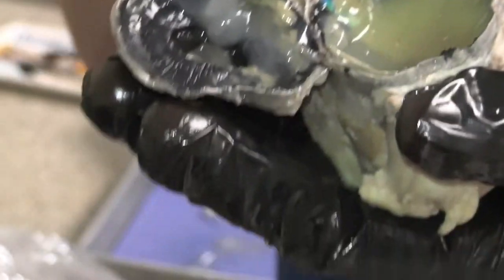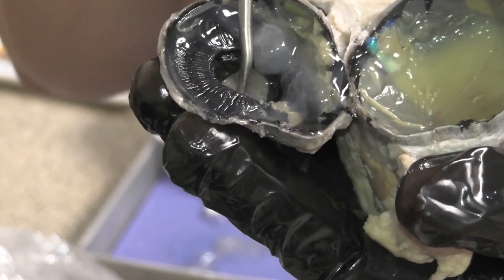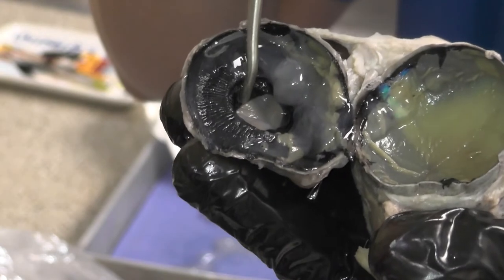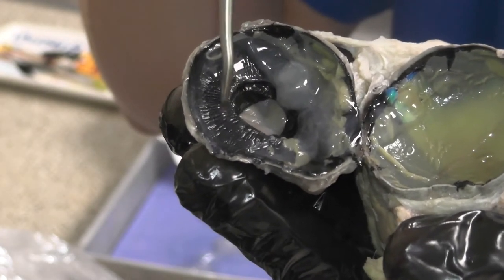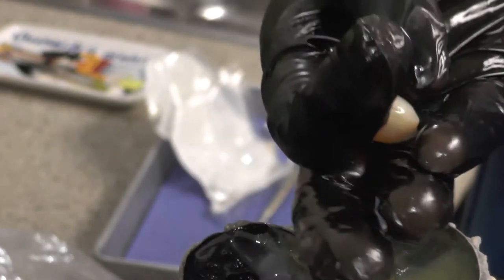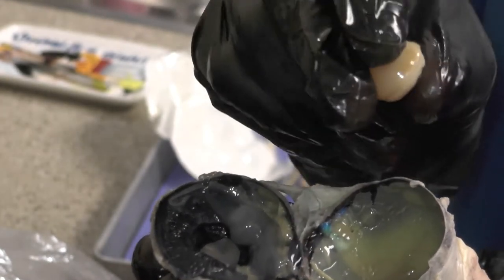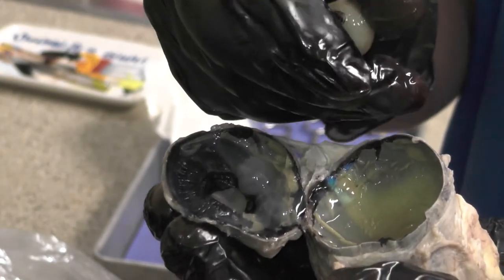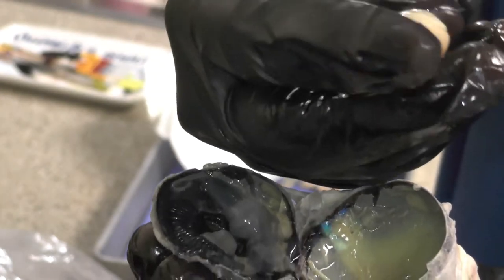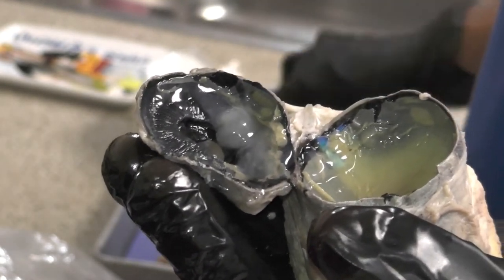If you were to walk up to a lab practical station and the pointer was here, you would say this is the cornea. If it pointed here, you would say this is the iris — it controls the pupil. Here are the ciliary zonules that are part of the ciliary body, which holds on to the lens and changes the shape of the lens based on whether you're focusing on something close or far away. Focusing close, it bulges; focusing far away, it flattens. This is a dead lens but it feels so solid.